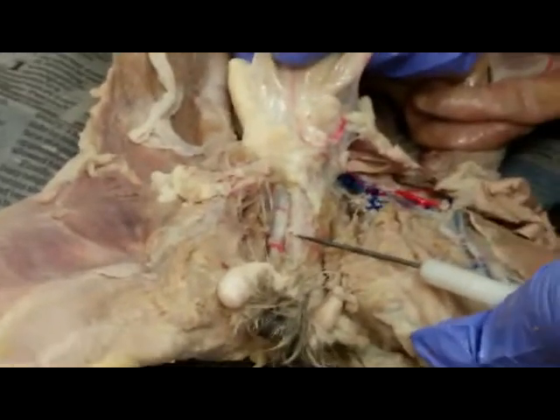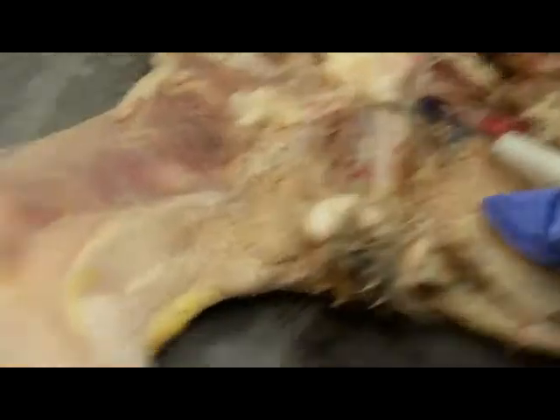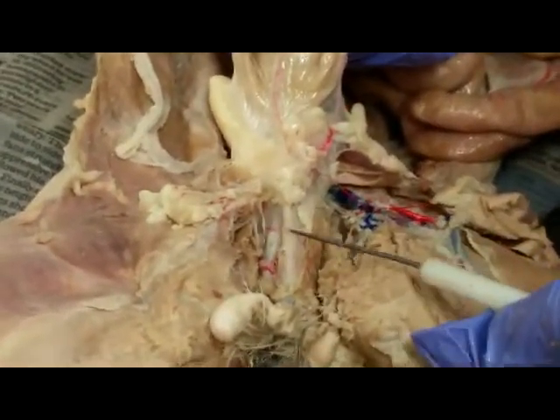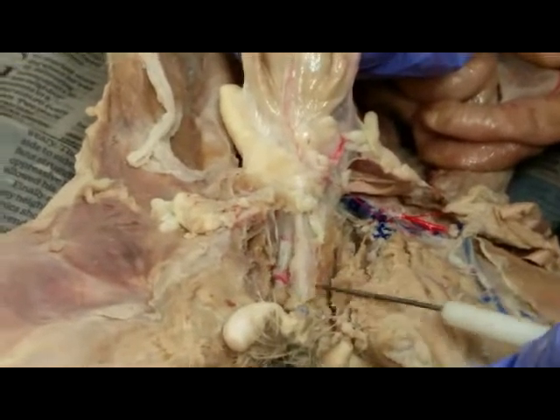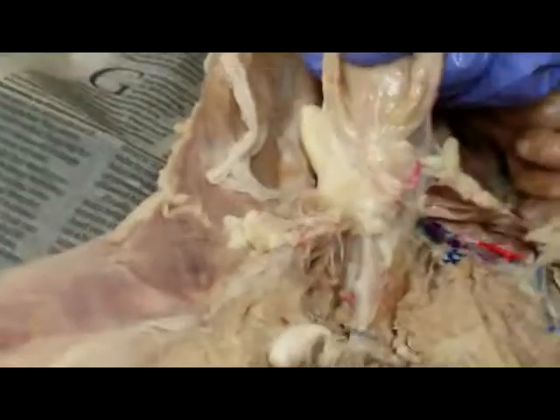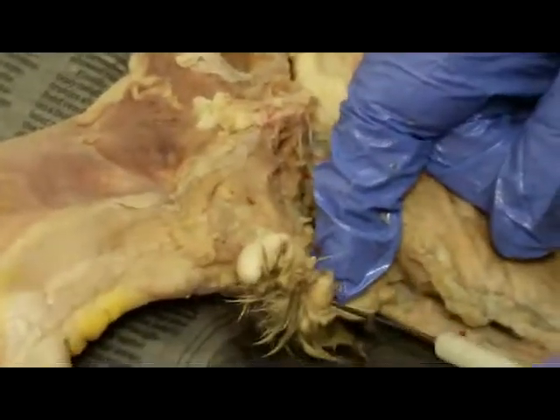This is the cat prostate gland, testicle. Here's the urinary bladder. Here's the urethra. And this part that bulges out, that is the prostate gland. And it passes through the prostate gland and now enters into the penis. So the penis is right here. Here's the tip of the penis.